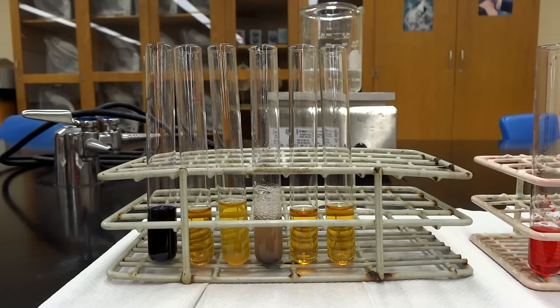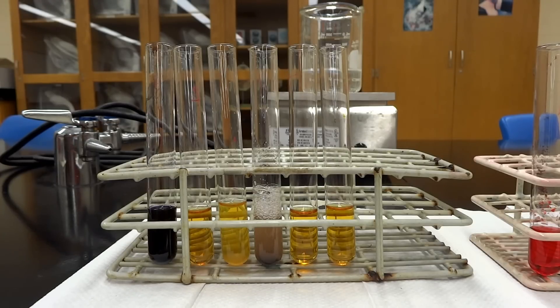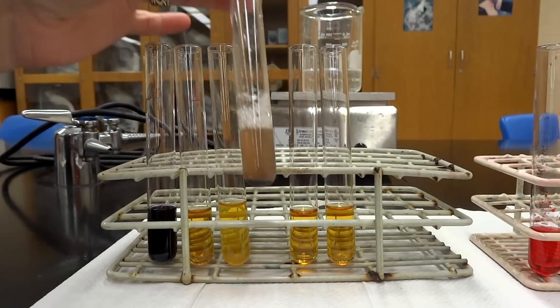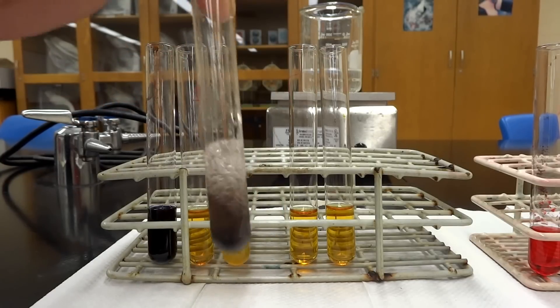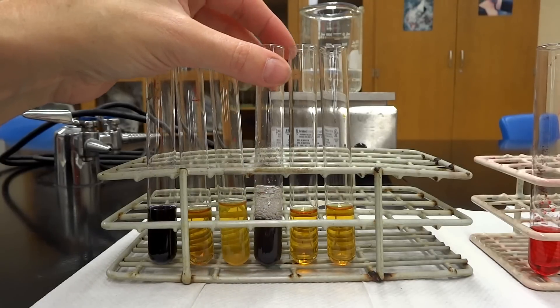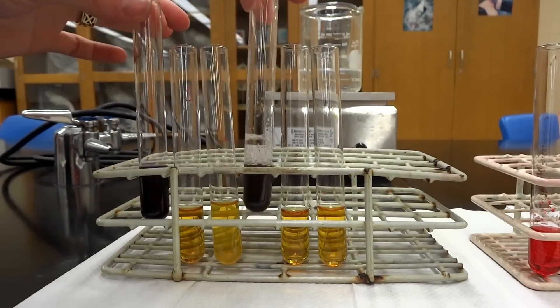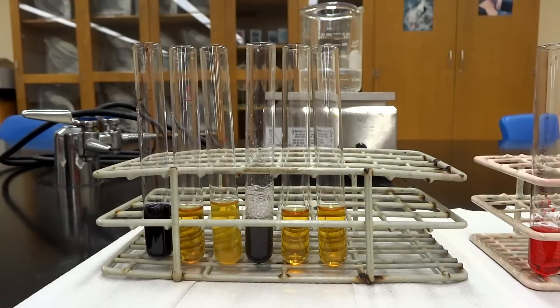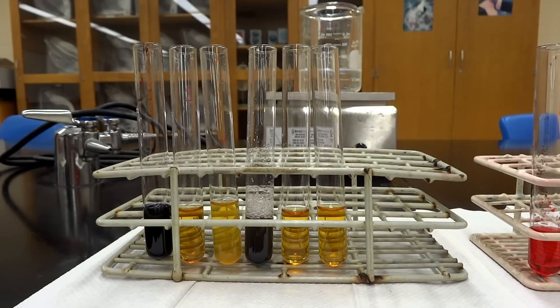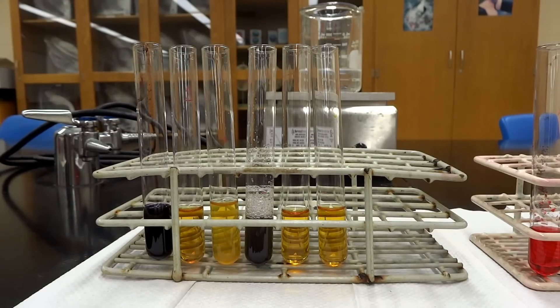Just by looking at this, you can compare the solution colors to our positive and negative control. The only tube showing any reaction is test tube number four — the potato. When you shake it up, because the potato chunks sink to the bottom, you can see it is a nice bright purple-black color, just like the positive control. All the rest look like the negative control, so they don't have starches. Potatoes have starch, onions don't — but onions do have the reducing sugar we saw earlier, whereas potatoes really don't.